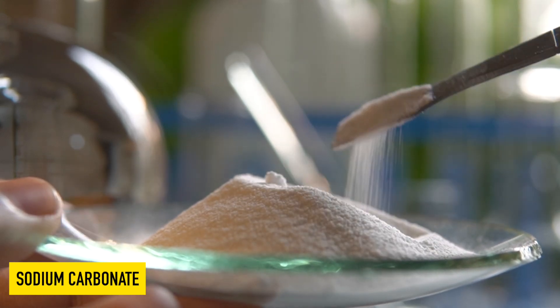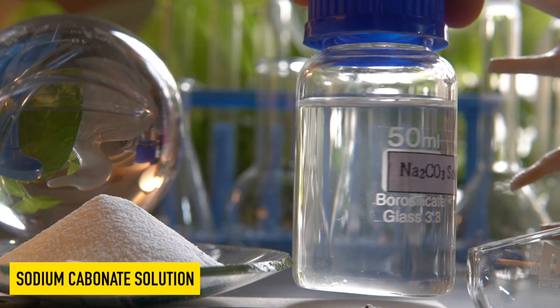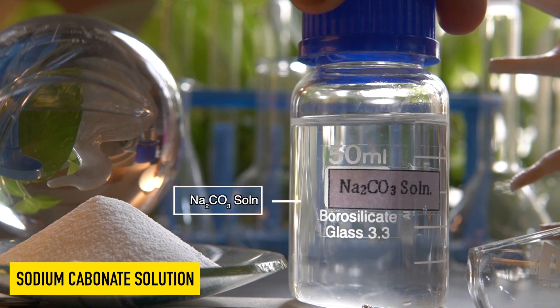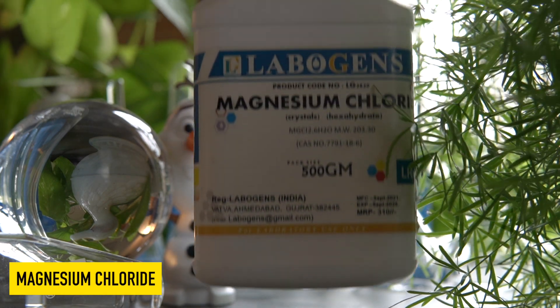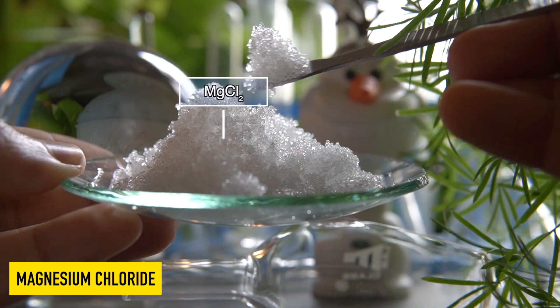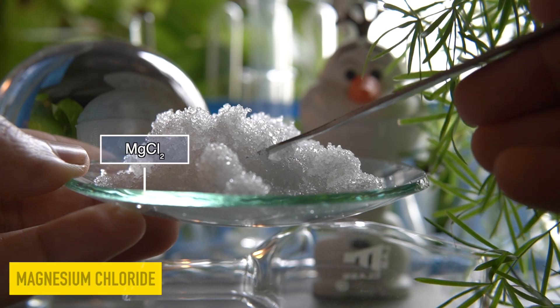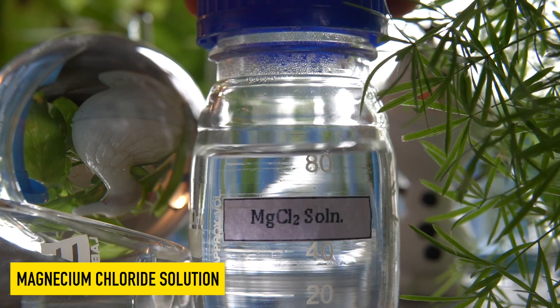It is soluble in water and can make a clear homogeneous solution. This is magnesium chloride, a deliquescent white solid — it means that it has a tendency to absorb moisture from air and dissolve in it. It is very easily soluble in water to make a solution.